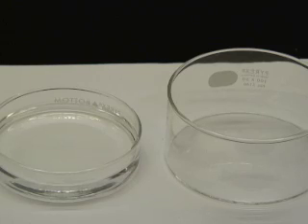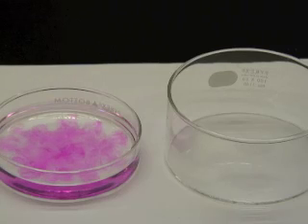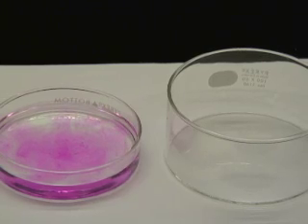The only reactants were lithium and water. Since hydrogen gas was produced, it had to have come from the water. I will use phenolphthalein indicator solution to identify one of the other products. The pink coloration tells us that the solution is basic. What ion is present in basic solutions? The hydroxide ion.